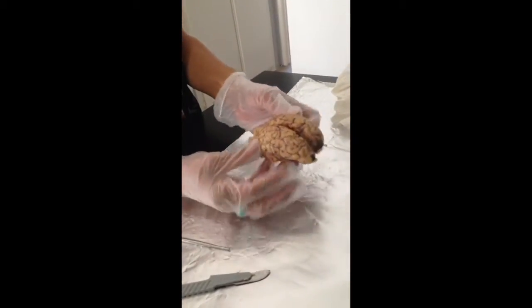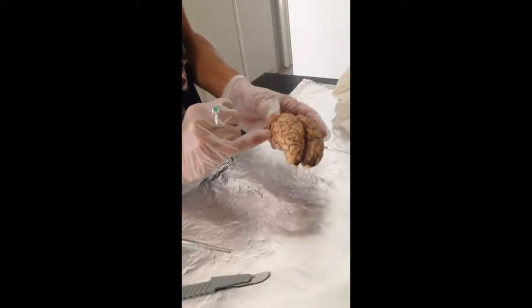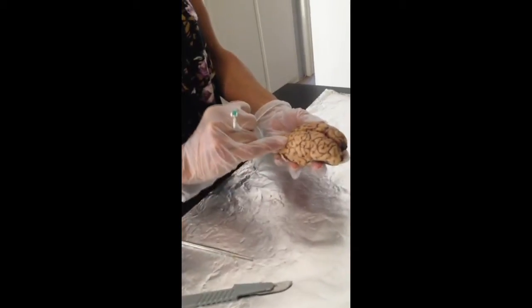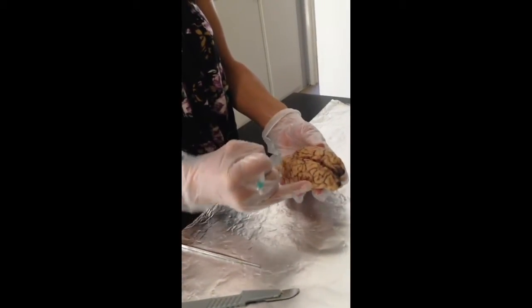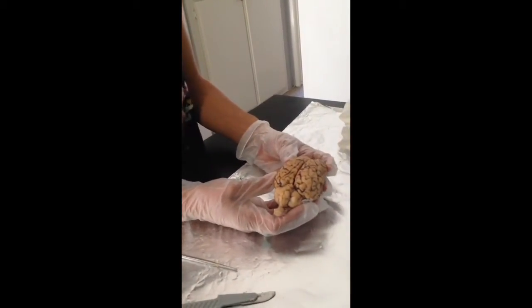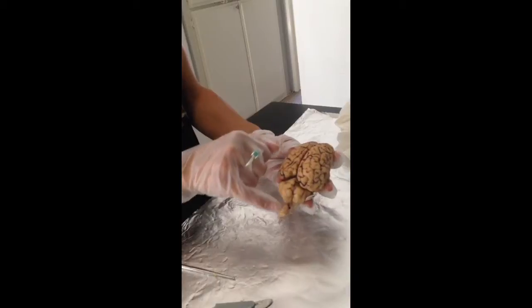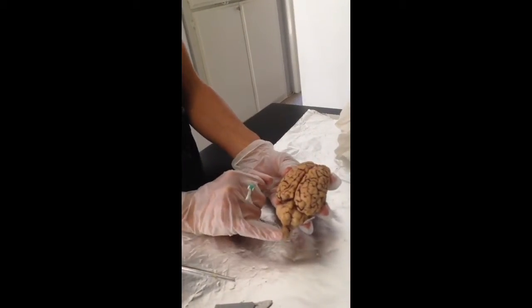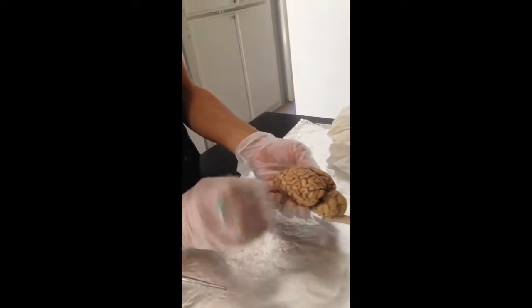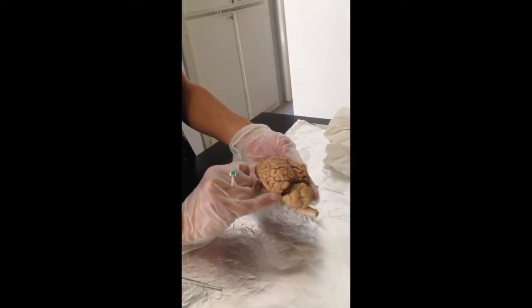We're going to demonstrate and describe the gyrus, which are the ridges and convolutions found on each hemisphere of the brain, and the sulcus are the little grooves found in between the gyri that give it the twisting look. The longitudinal fissure that separates the right and left cerebral hemispheres runs from here all the way down towards the back of the brain. The lateral sulcus is found on the side on each hemisphere, and it separates the parietal lobe from the temporal lobe.